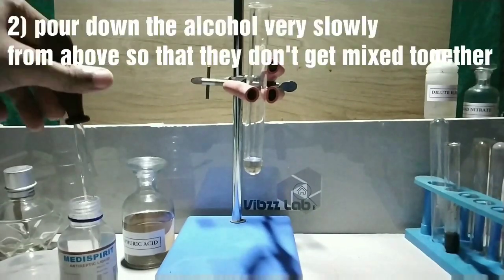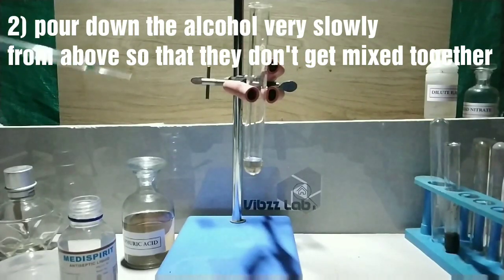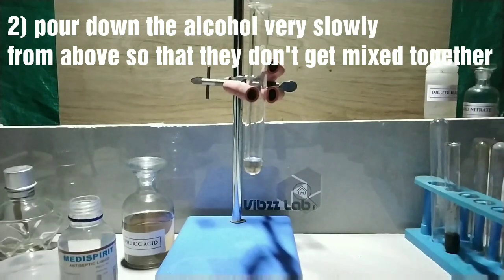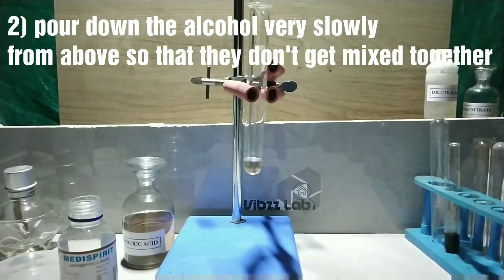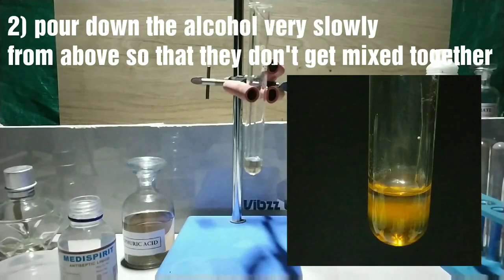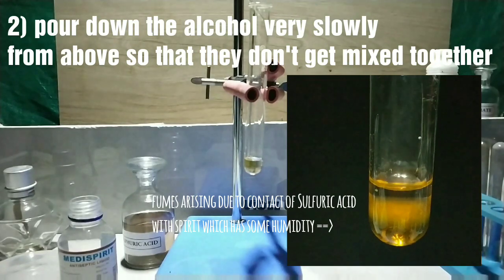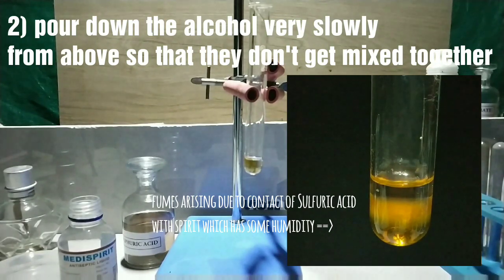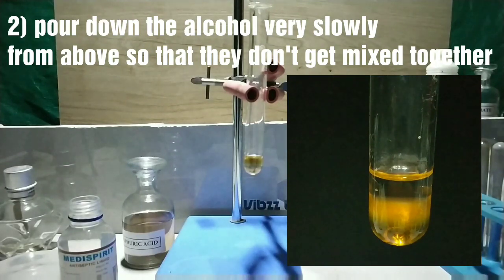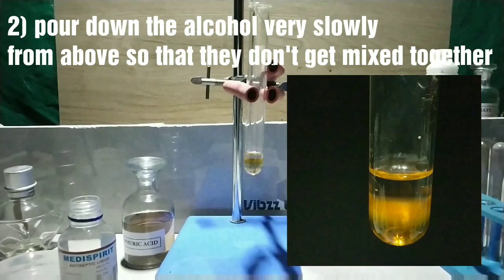The next step is to add the alcohol into the test tube. We should be careful that the sulfuric acid and the alcohol do not get mixed together, so we are pouring the alcohol very slowly so that it forms a separate layer above the acid. You can see that a separate layer is being formed above the sulfuric acid layer — there is the alcohol layer.